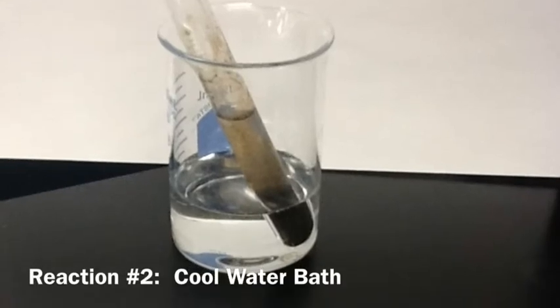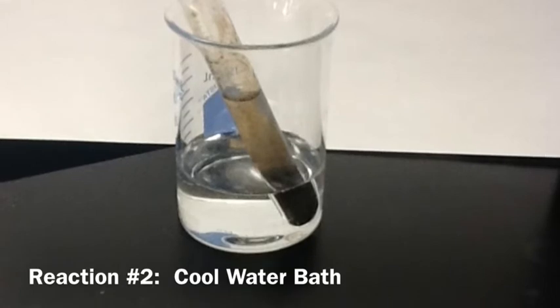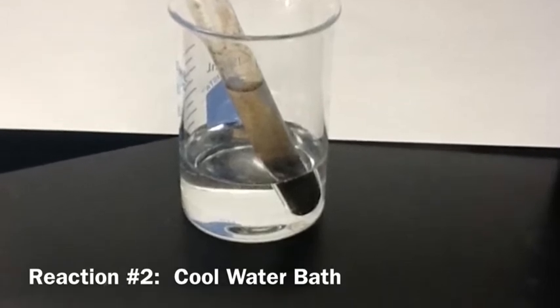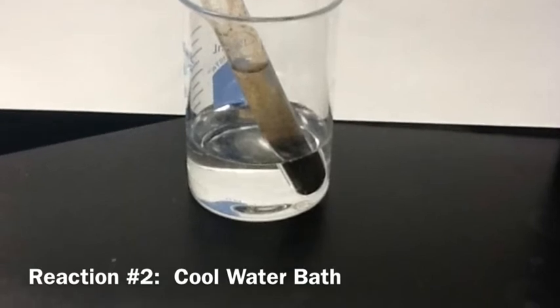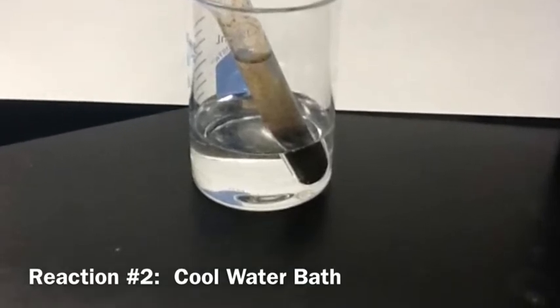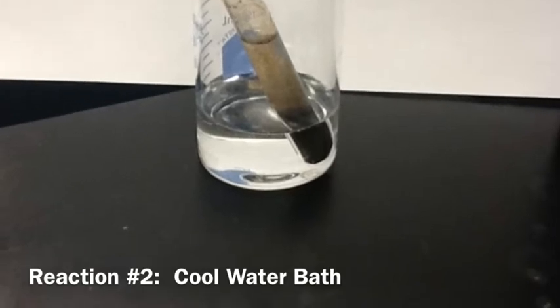Before you start the next reaction, the copper 2 oxide needs to cool off a bit. So take your second 150 milliliter beaker, and this time you can use tap water and fill it about halfway. Put the test tube into the cool water bath and allow it to cool for about 2 minutes.